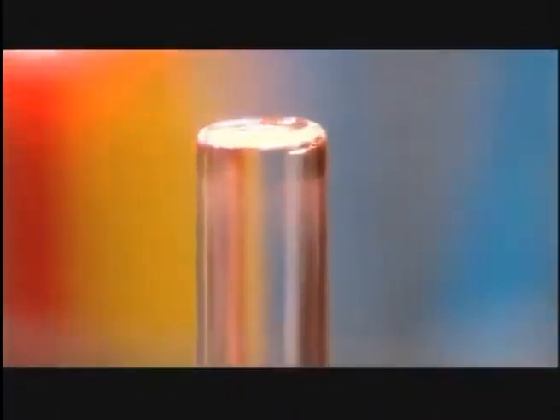A bottom turret plucks the newly created one and draws out the soft glass to lengthen it. Fingers inside the turret prevent the glass from breaking. All that's left now is shaping the bottom of the vial. A burner forms a concave base in less than a second.